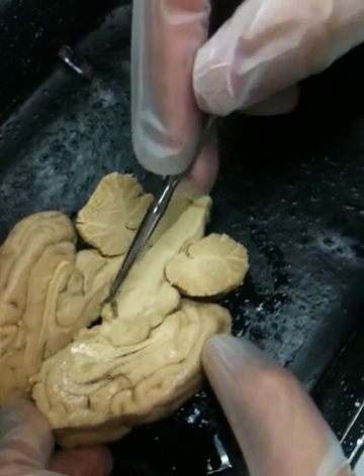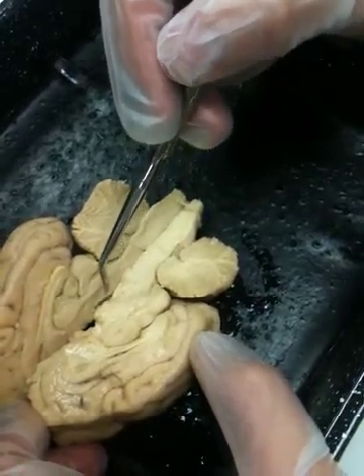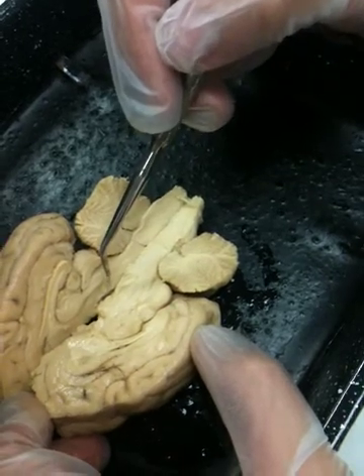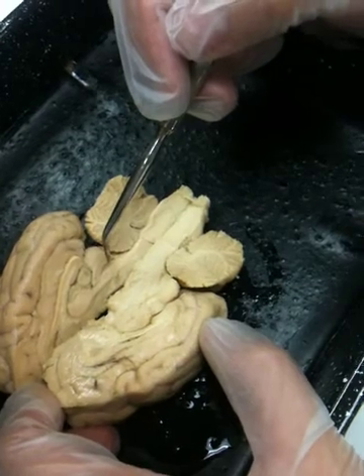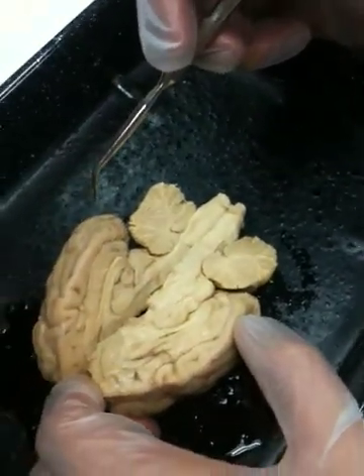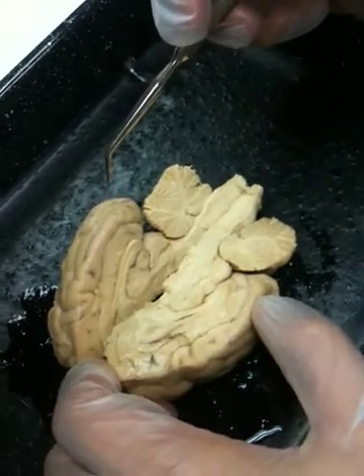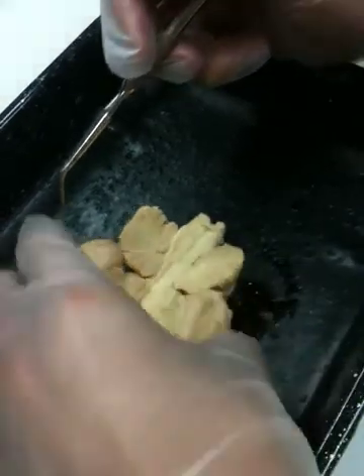The pituitary gland is not on this particular brain, it's been removed so that we could make the sagittal section easily. If your group has still in place, it'll be a large structure hanging off the under surface. Now, the reason I do have a pituitary gland still in place is because on this one, when they dissected, I saved this one. The pituitary gland was removed with the membrane still intact. But someone around still has this inferior membrane. If you turn your brains upside down, this large structure here is the pituitary gland.